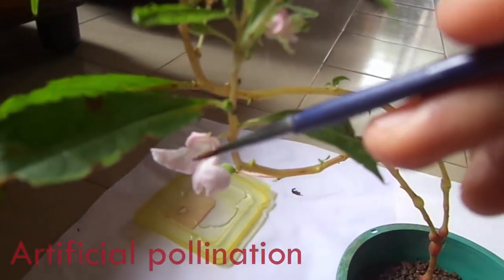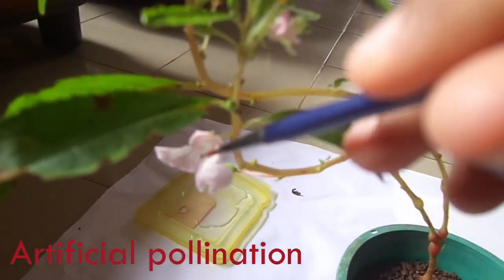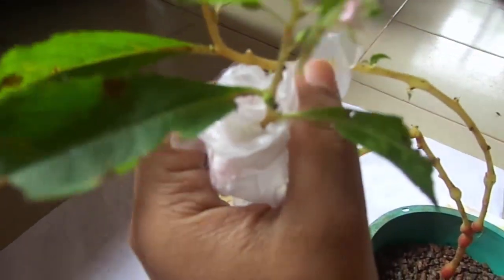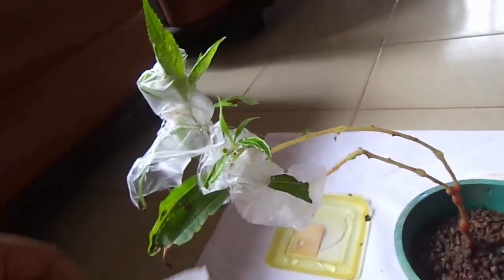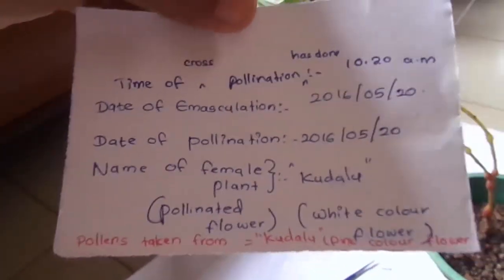These pollen are then applied on the female part of the white flower. This is gently done without damaging the delicate flower parts. Next, we do the bagging of the artificially pollinated flower using a polythene cover, to prevent random crossing with other flowers.